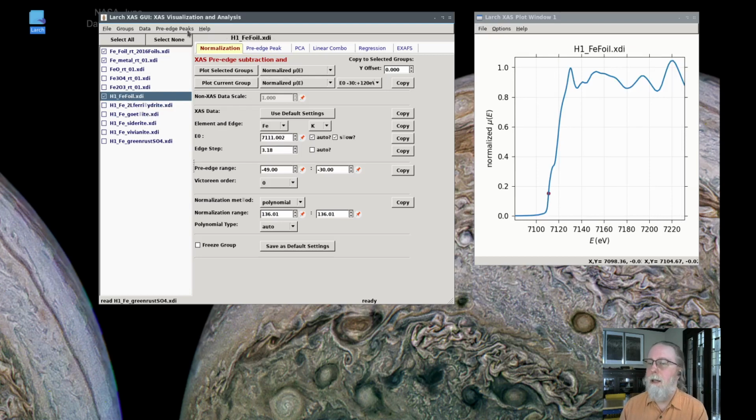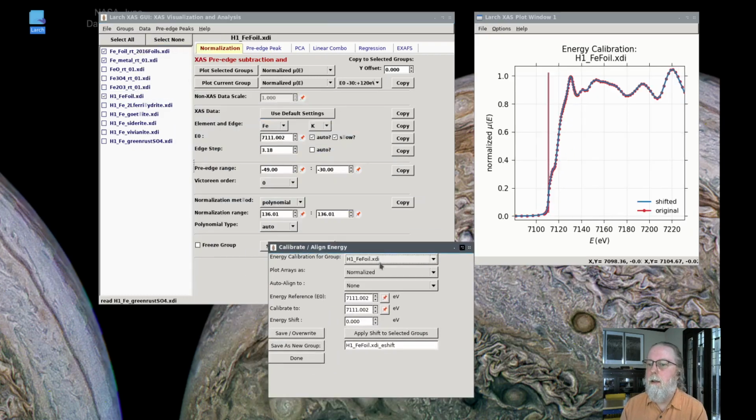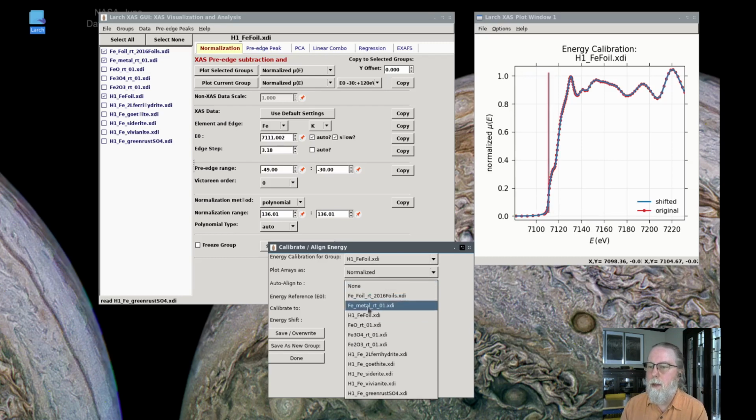So to calibrate the energy, we will go to the data menu and then Recalibrate Energy. The corrections I will show you all come from this data menu. So recalibrating the energy brings up this dialog. If I say I want to do the energy calibration for H1 iron foil, I could either calibrate that and apply a constant energy shift here, or I can say auto align to another spectra.